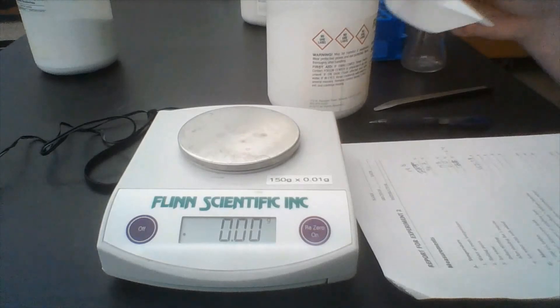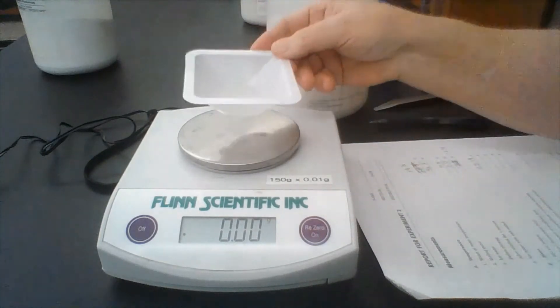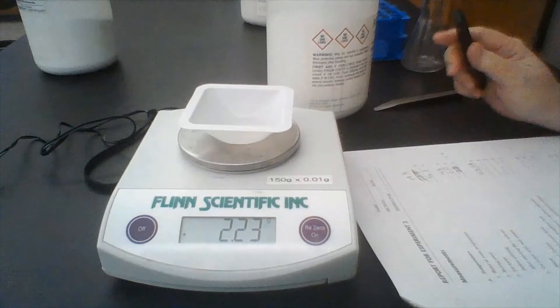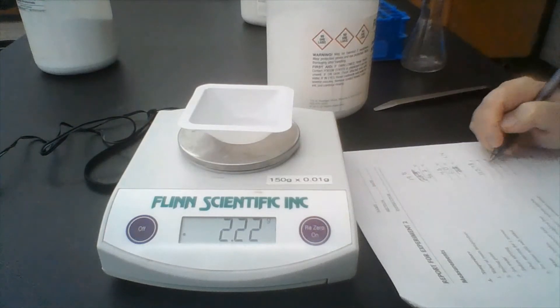Now I'm going to weigh a weigh boat, make sure my scale is zeroed first, and put the weigh boat on there. I get 2.23 grams for the weigh boat.